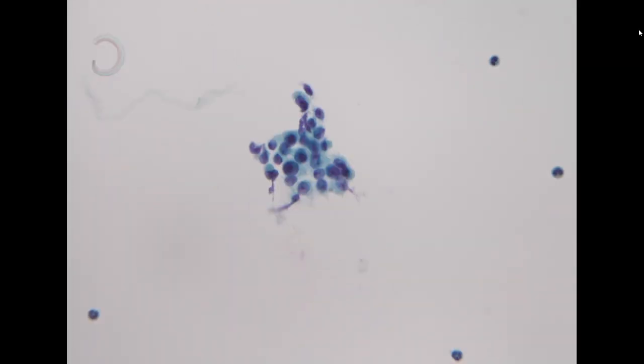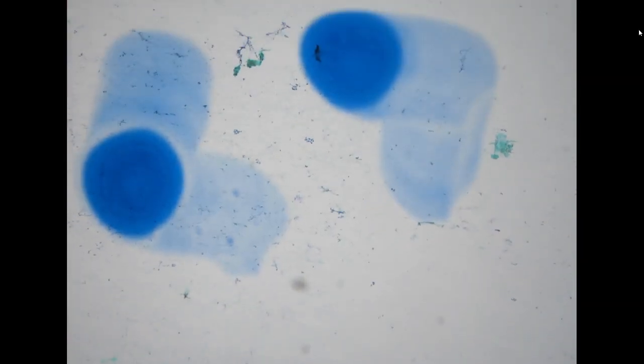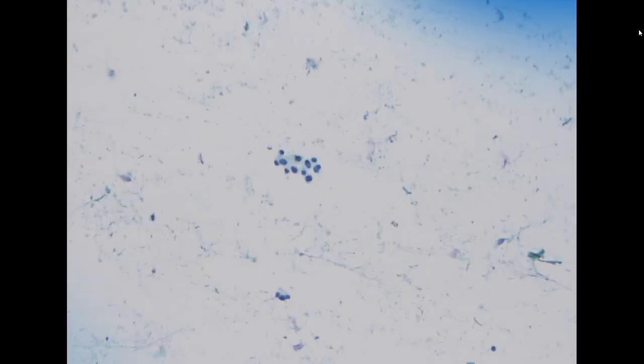However, we can still appreciate these atypical cells, some with eccentric nucleoli, and in clusters, which suggests an epithelial origin. So it looks like a carcinoma, and it can be compatible with the patient's prior history of ductal carcinoma. So even though we have very low cellularity, given this type of atypical feature, I'm still comfortable calling this positive for carcinoma.